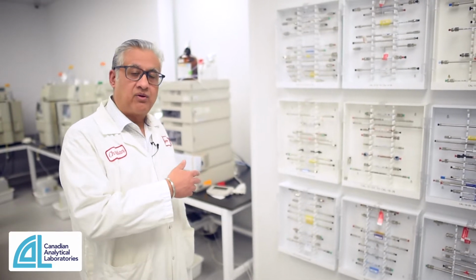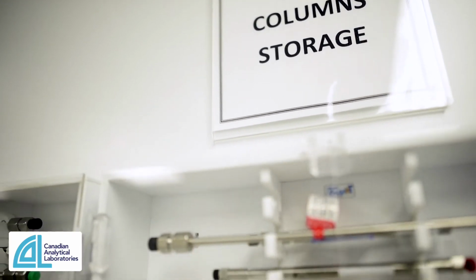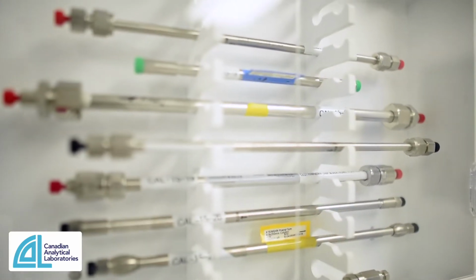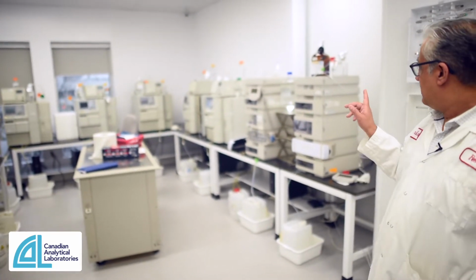So this is a column storage area where we keep most of our HPLC columns. Kind of a cool feature that a lot of people enjoy during the tour. We keep our dedicated columns here. It's another HPLC lab that you can see. Again, predominantly Waters machines here, 1 or 2 Agilent machines.